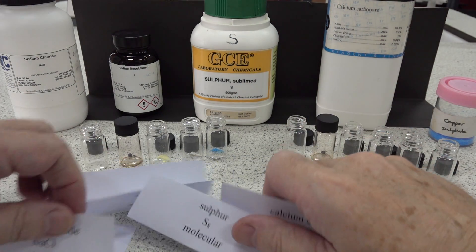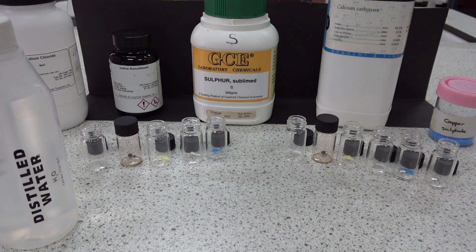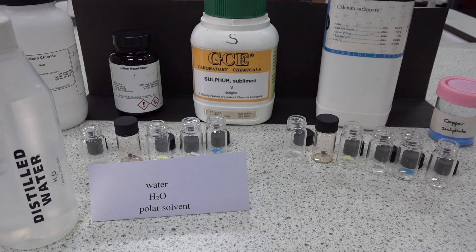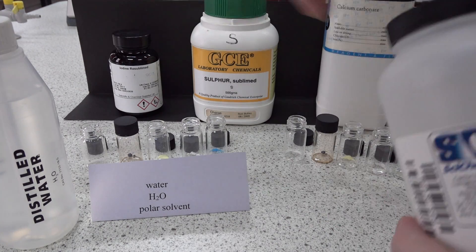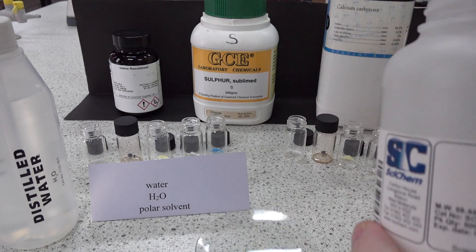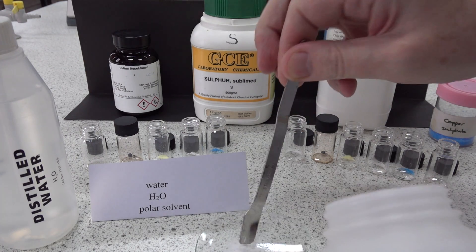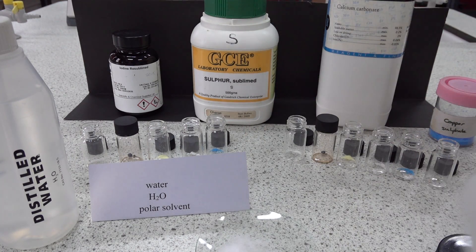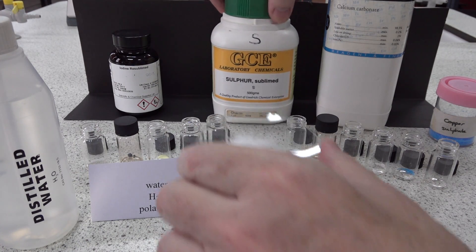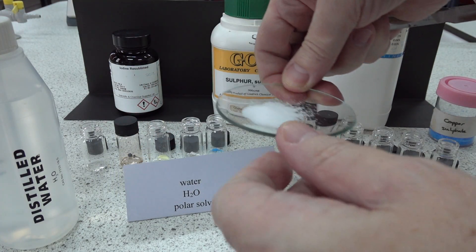Water is a polar solvent and we've already got some sodium chloride in the tube. Let's confirm what it looks like as a material - we've got a black background to help. There's the sodium chloride - a general spatula measure. It's a white crystalline solid, which you may be able to pick up on camera, or against the black background.